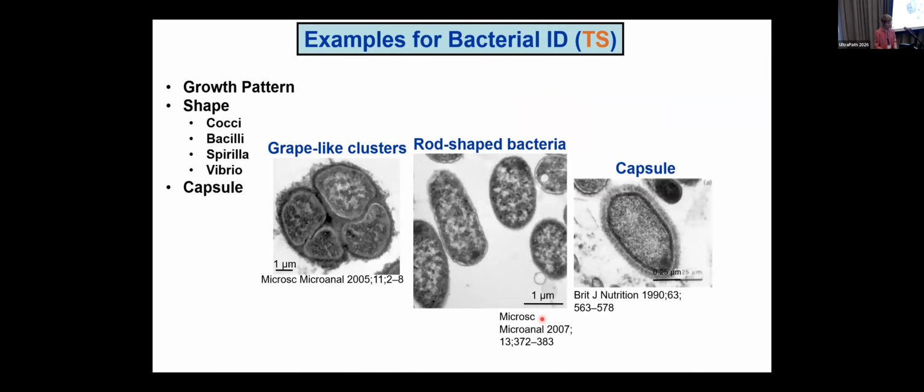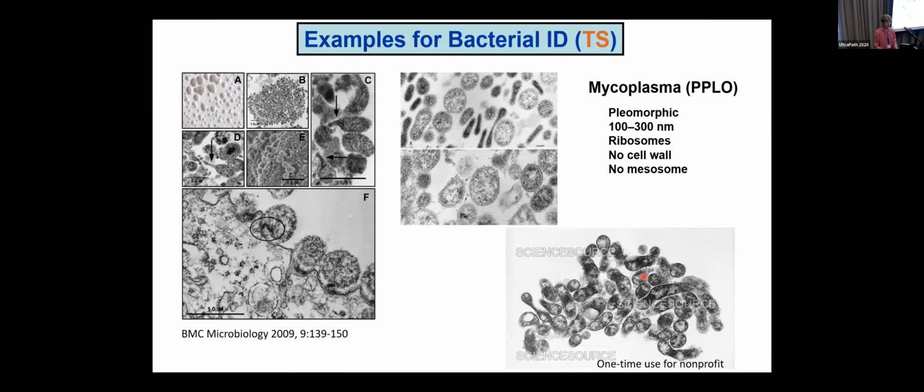Here are other bacterial examples. This one is growing in grape-like clusters. It's pseudospherical or coccoid. This is a rod. It's gram-negative. This is a rod as well. But in addition, the one on the right has a capsule around the outside. And the capsule helps the bacteria evade the immune response. These are funny bacteria. They are bacteria, but they don't have cell walls. They are mycoplasma, and we'll have more to say about them in another talk later on. But you can see that these are stuck to the outside. They've attached themselves to this cell, but they don't have cell walls. Because they don't have cell walls, they can take a bunch of different shapes.